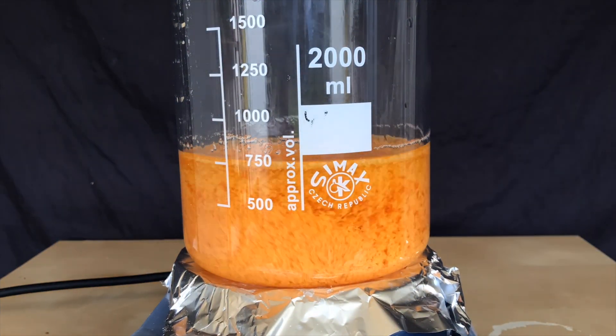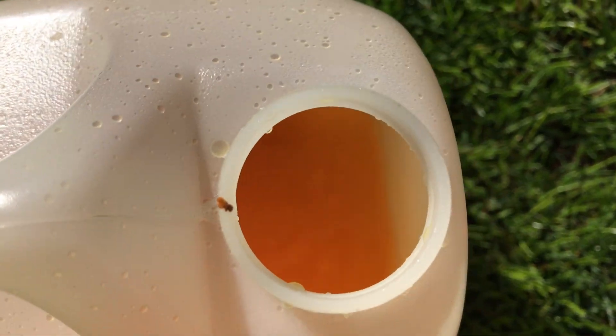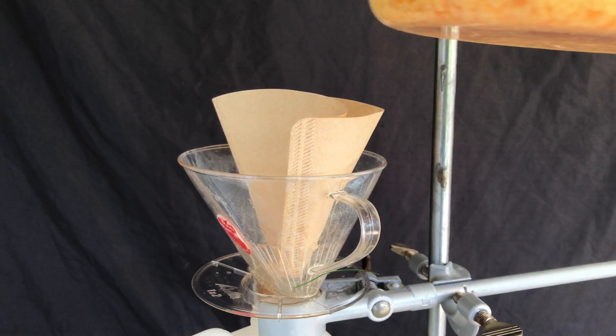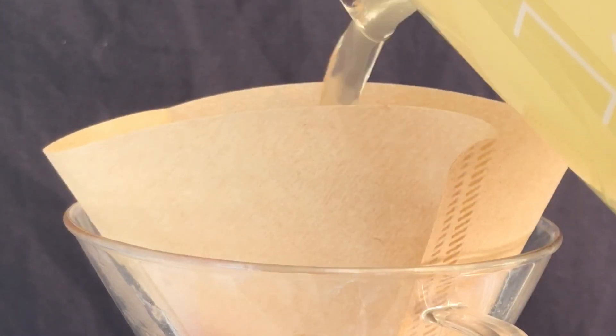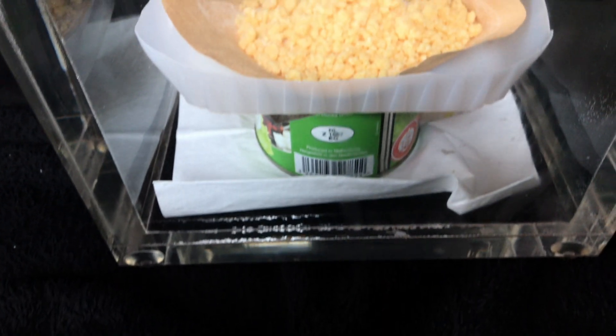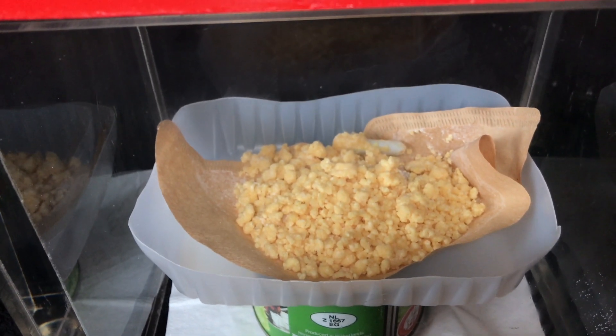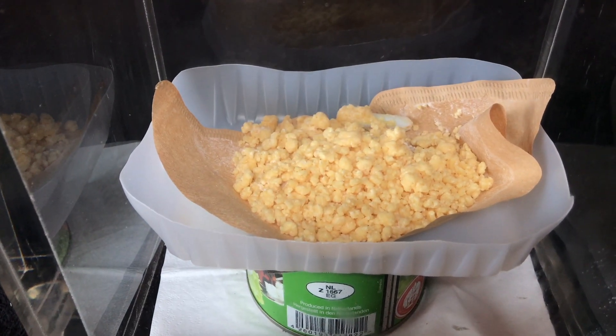The lumps became larger and it looked like a lot of the bromine dissolved in the water. I talked about bromine formation before, and now a lot of bromine vapor was visible in the wastewater canister. The product looked much cleaner and I was ready to perform another gravity filtration. The beaker was allowed to cool overnight.